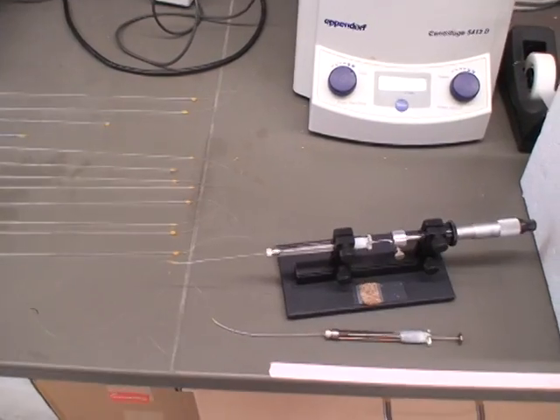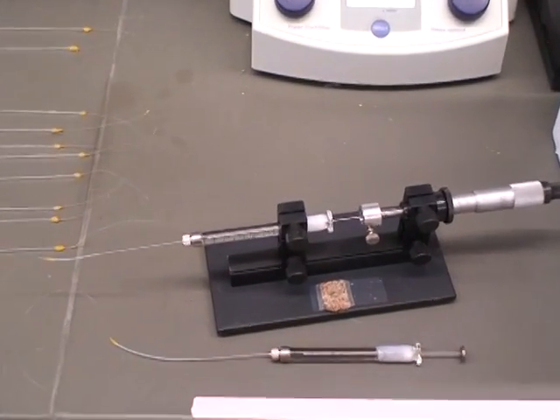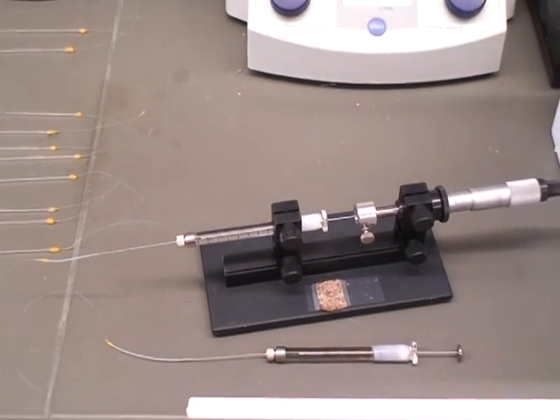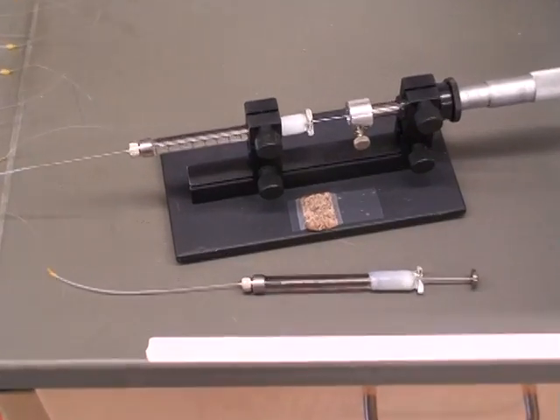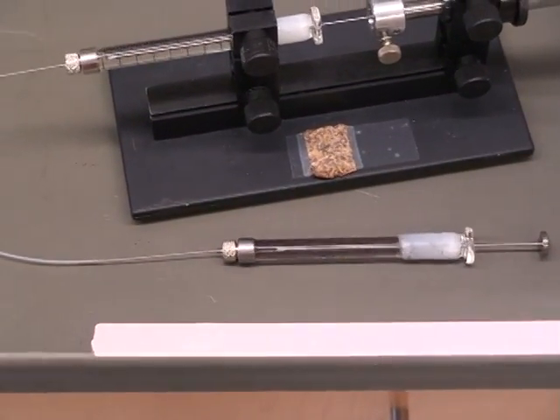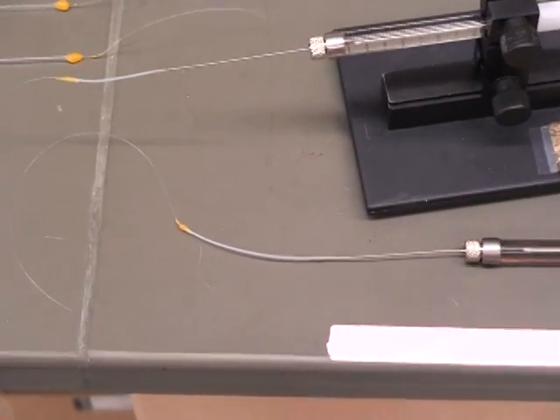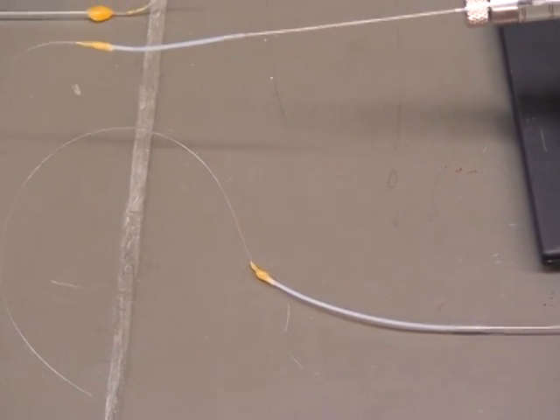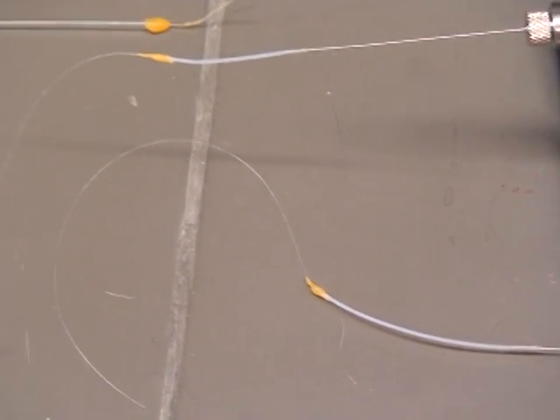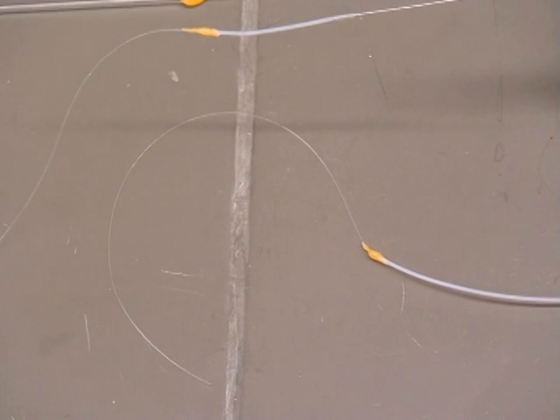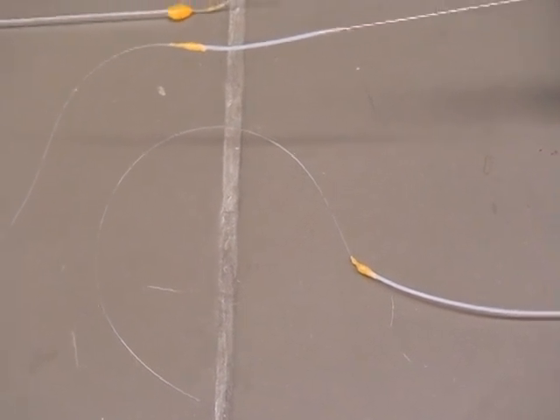The cartridges are formed using this manual aspirator right here, with the syringe attached. This syringe here is an example, you have the syringe connected to large Teflon tubing, which is connected to the small Teflon tubing using wax. The cartridge will be formed in this small Teflon tubing, and then directly pumped into the PDMS device.